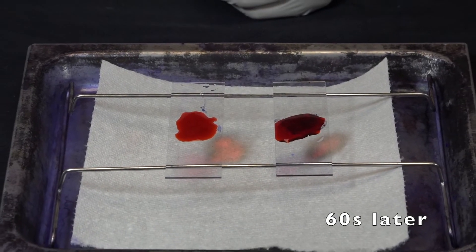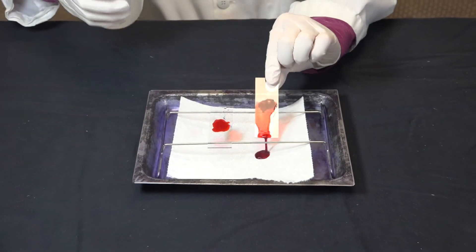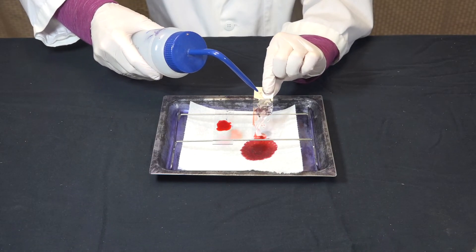Now I'm going to rinse off the excess counter stain with distilled water. Just like before, spray the water above the smear and let it run across.